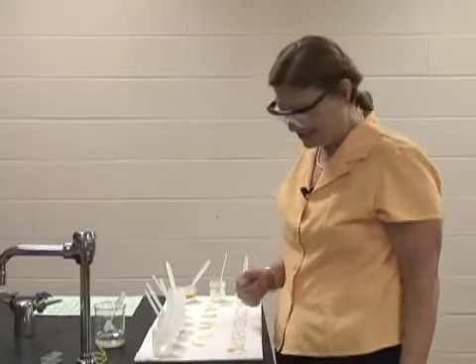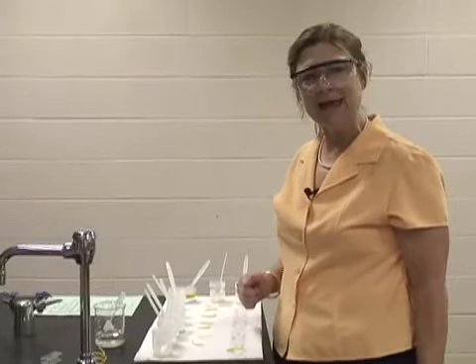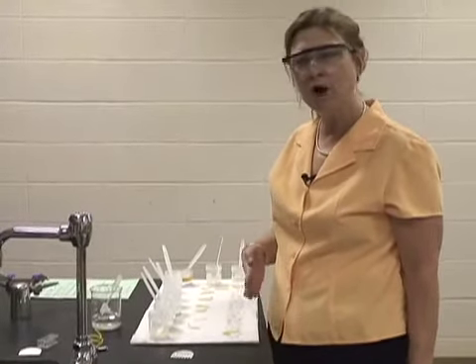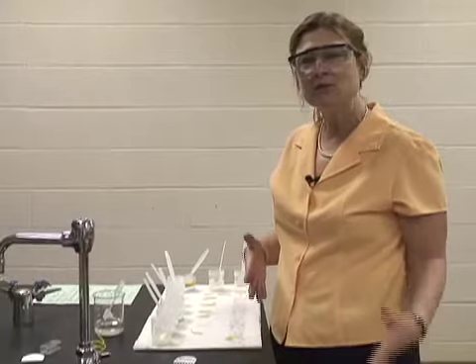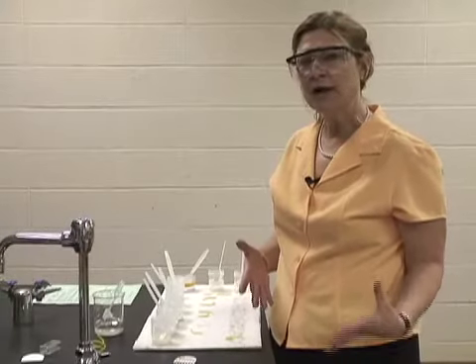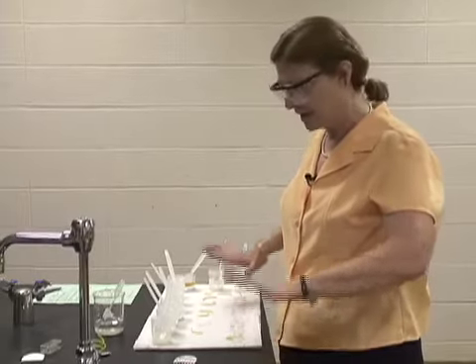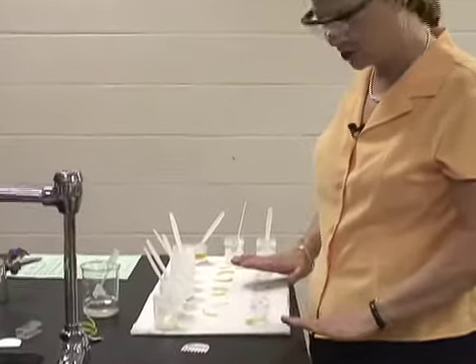I just love doing lab. It's just so exciting. Well, today I'm using pH paper to determine, when I add these salts to water, what is the pH? Is it going to be acidic, basic, or neutral? That's what I'm looking for. I spread out a nice paper towel so that I have a place to add the water and the salts.